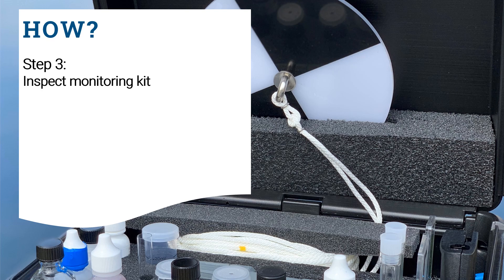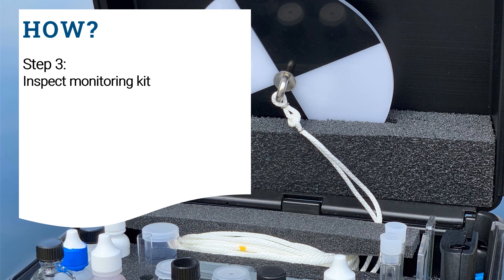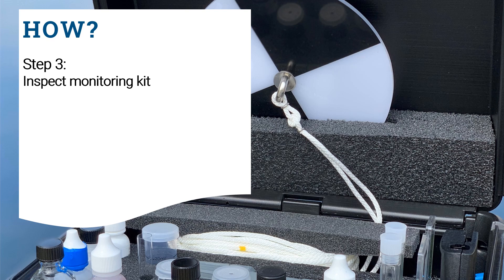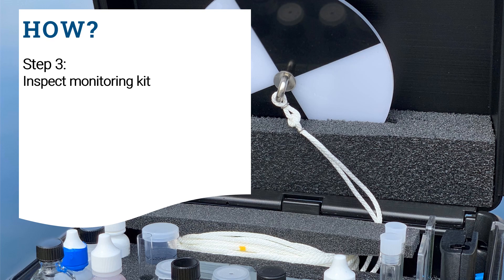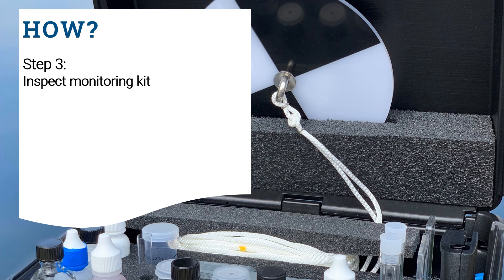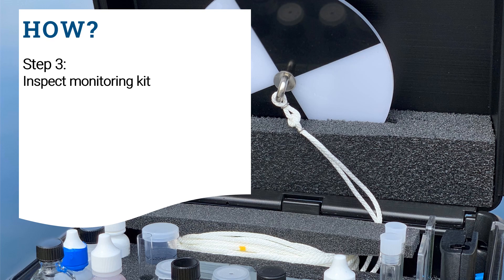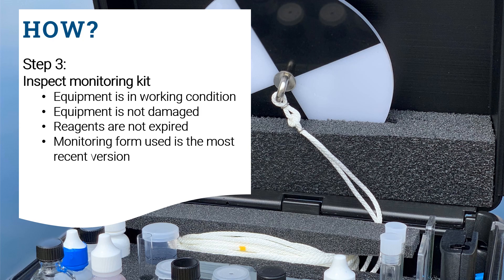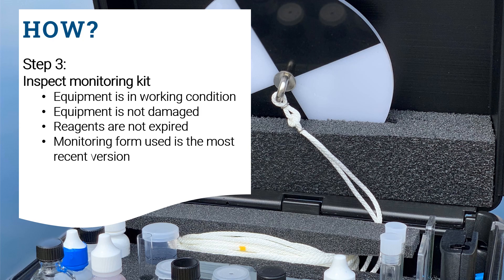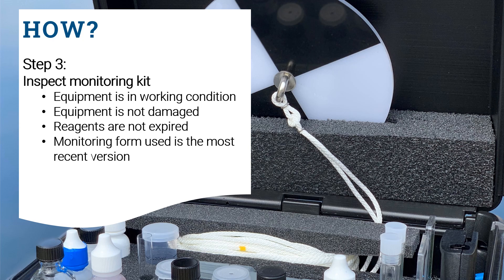Step three: the monitoring kit and all equipment and reagents must be inspected by the trainer and/or quality assurance officer at the beginning of the session, as applicable to the monitoring type. The main things to look for include malfunctioning or damaged equipment, reagent expiration dates, and use of the most recent monitoring form.